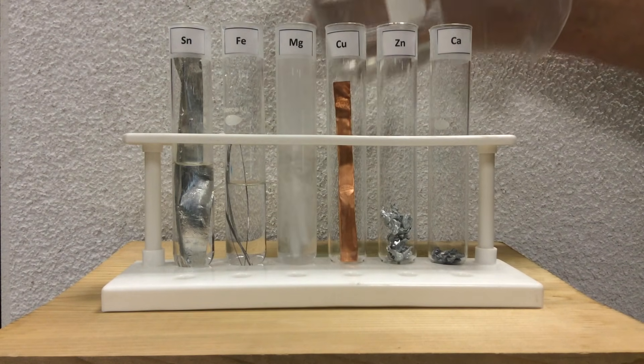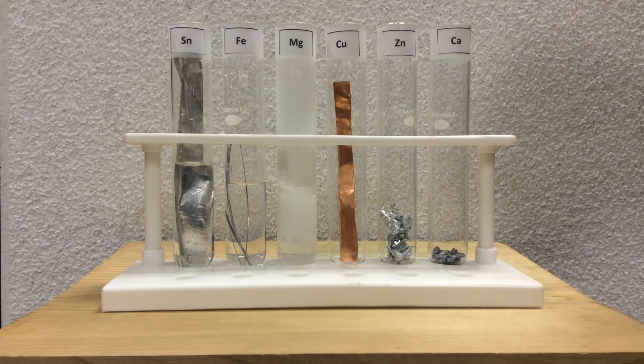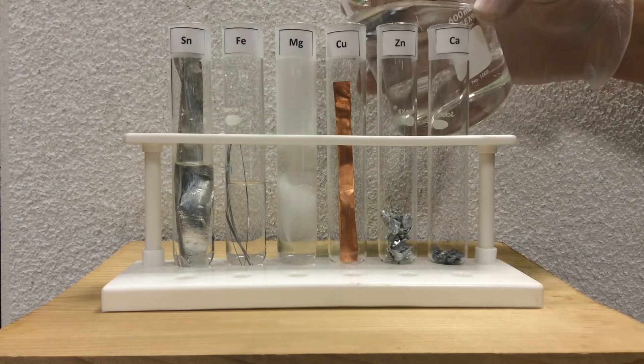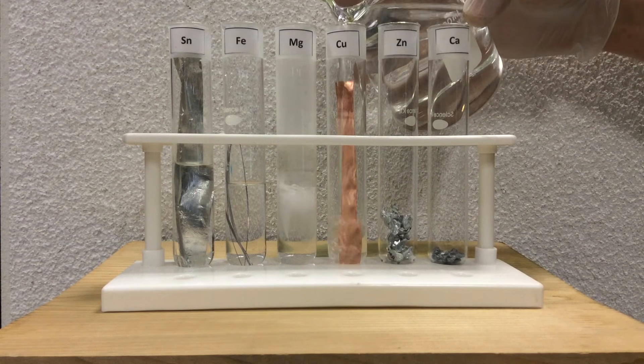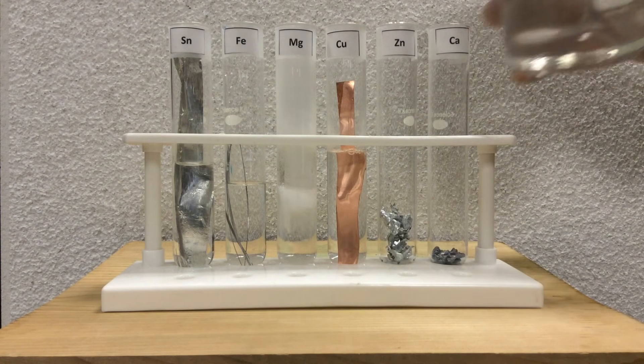Which one is best at giving its electrons to the protons. As you can see the magnesium, very reactive as the zinc and iron don't seem as much. And the copper, as we probably would expect, is not very good at oxidizing.